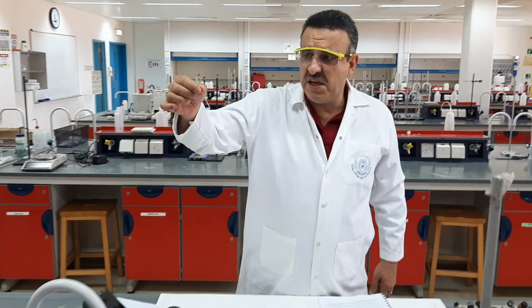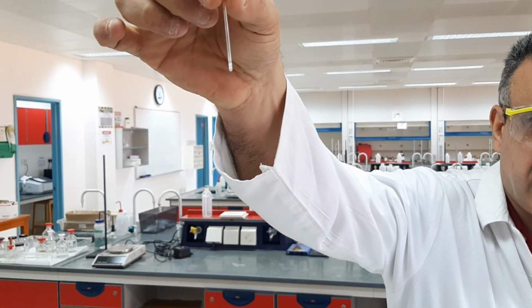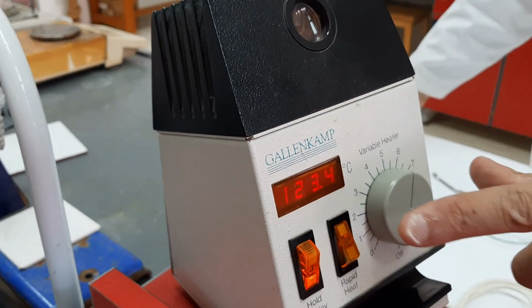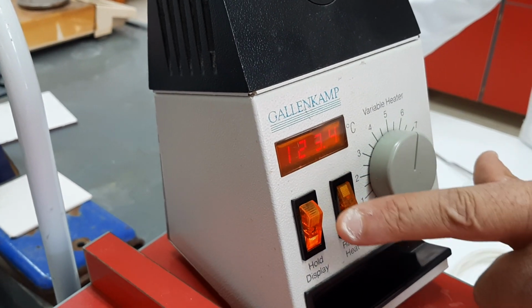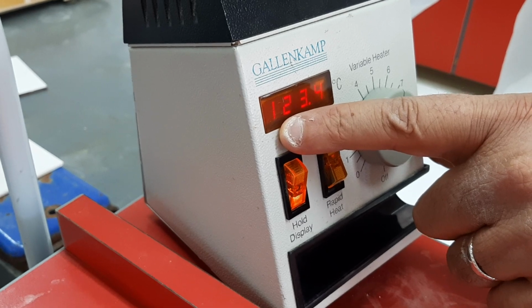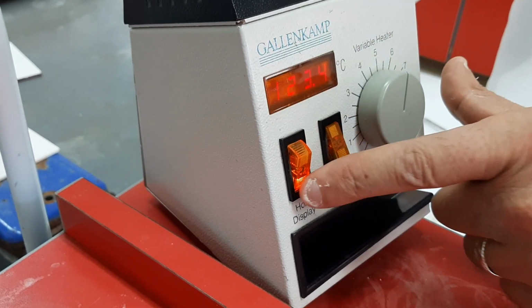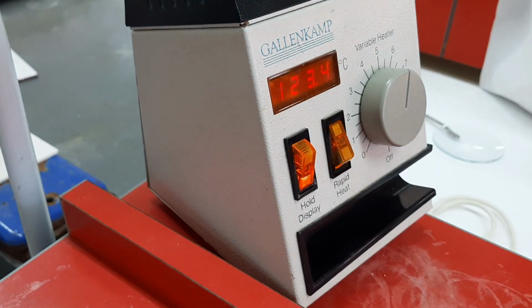All right. As you can see here, the solid has been converted fully to the liquid state. And as you can see, I have used the hold display in here because I recorded the initial melting point, when the compound starts to melt, which was 121.7, and then I finished the experiment, or stopped the recording, when the solid fully converted into the liquid phase. In order not to lose this screen, I use the hold display, which simply holds the display when you press that knob.